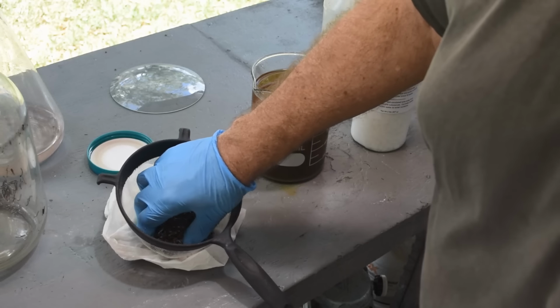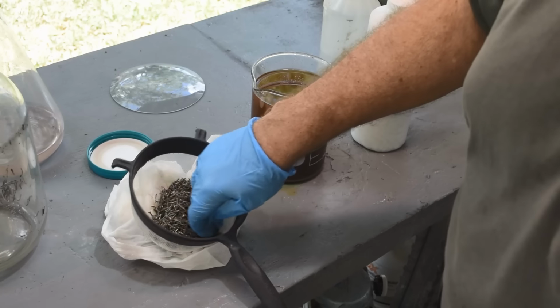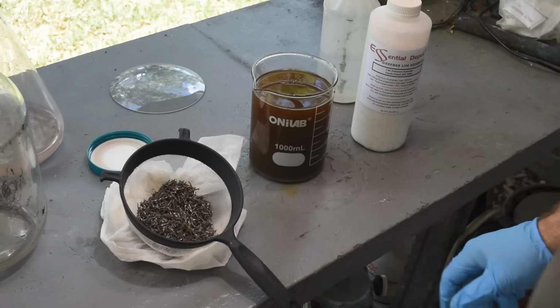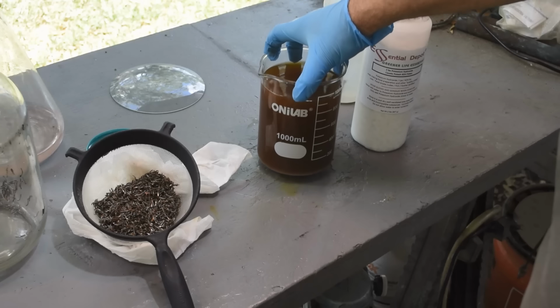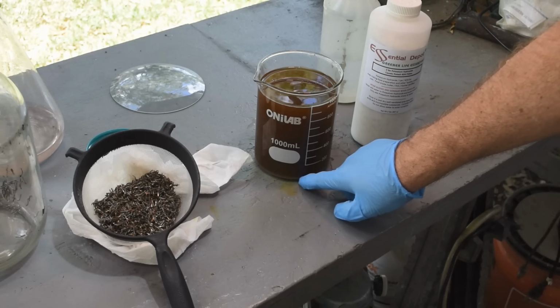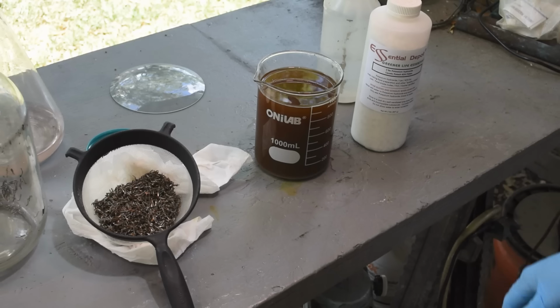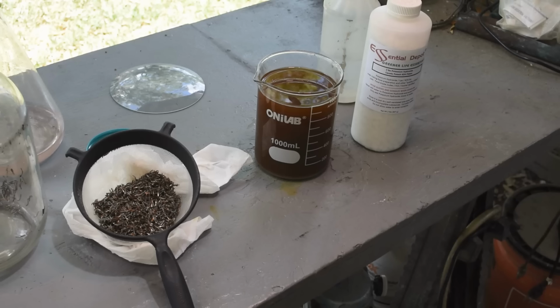I guess I was eager to get this going because it's supposed to rain later. I wanted to get it done before the rain started. But certainly we did get the vast bulk of the gold off of them, and without turning this stuff into a very light brown, thick mud, like normally happens when I use the iodine leach and leave it on the pins for a long period of time to try and get all the gold off. Now we do have a little bit of a light colored precipitate down here, so I think we did pick up some tin. But again, it's nothing like what it normally looks like. I would say this is an improvement.